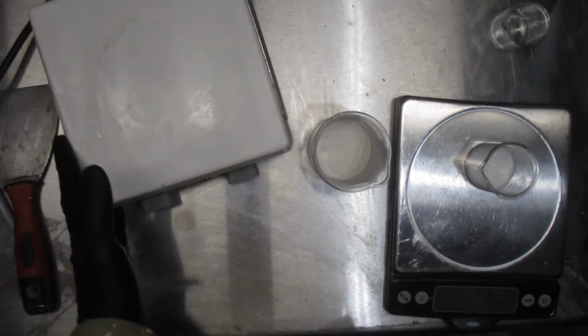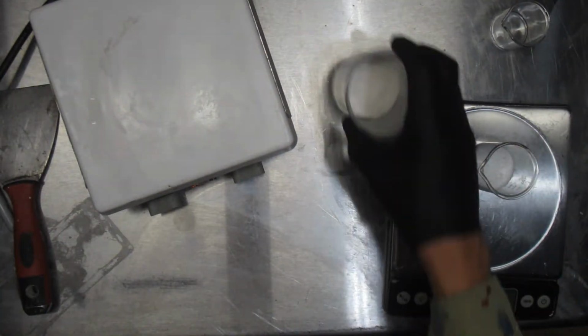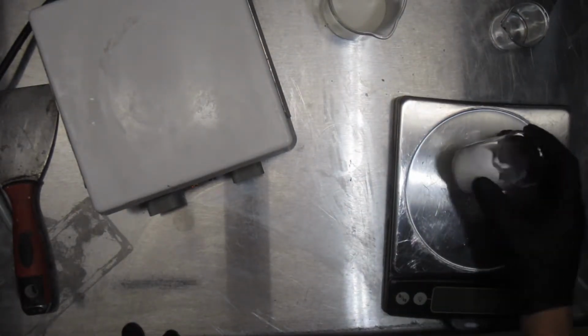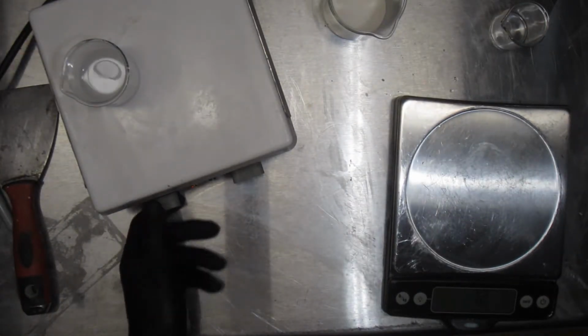We're back at it. You know, I'm going to leave these mistakes in the video because nobody learns anything from when you do it right. You really don't. So this is you and me, we're both learning together. So I got my stuff weighed out here. Oh, we need about 30 mils of water here. Onto the hot plate.